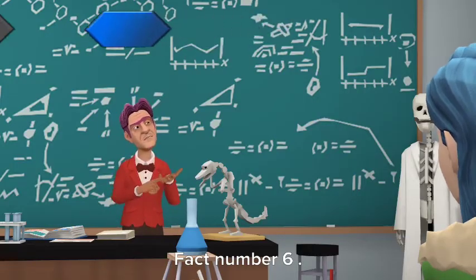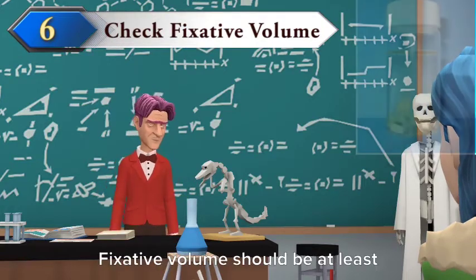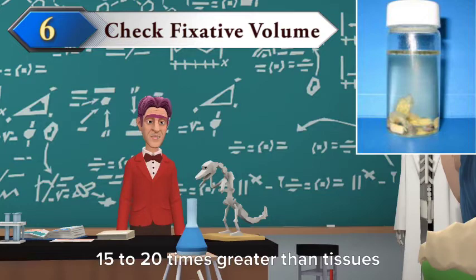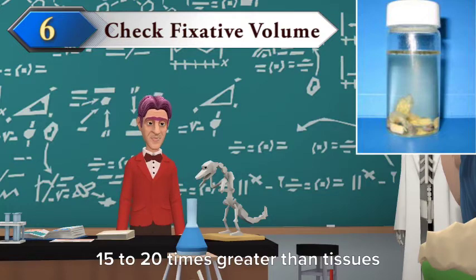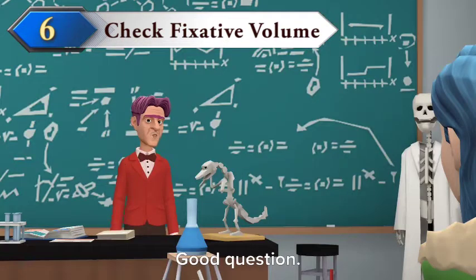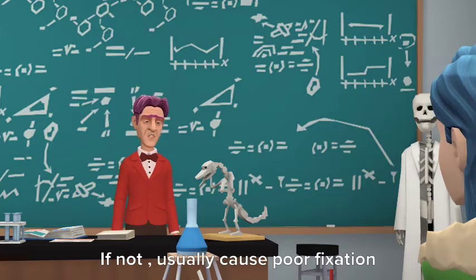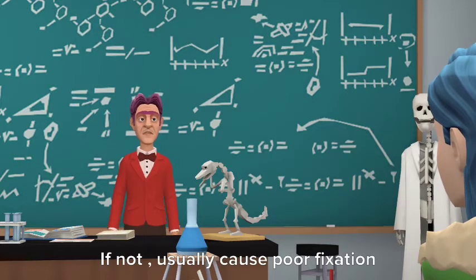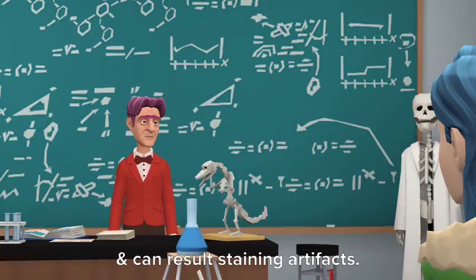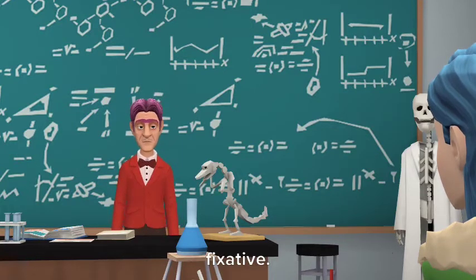Fact number 6: we should check the fixative volume. The fixative volume should be at least 15 to 20 times greater than the tissue volume. If not, it usually causes poor fixation and can result in staining artifacts, so we should add enough volume of fixative.